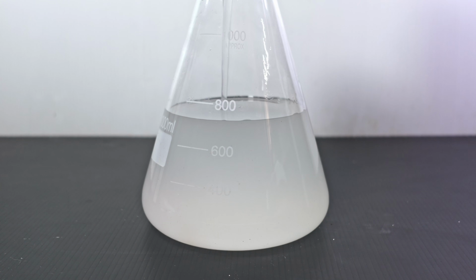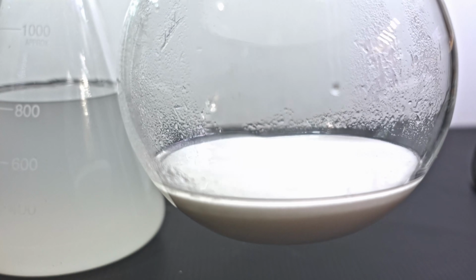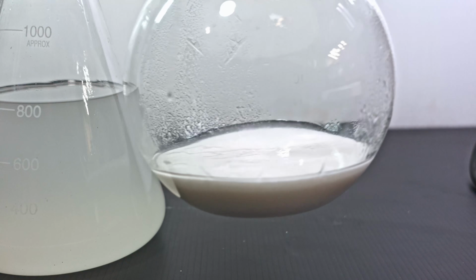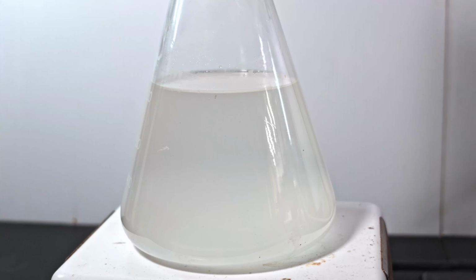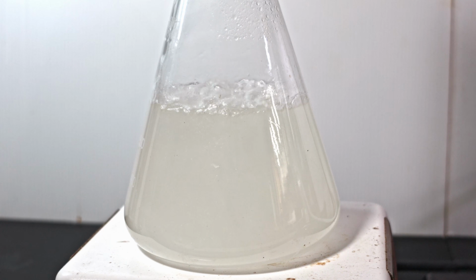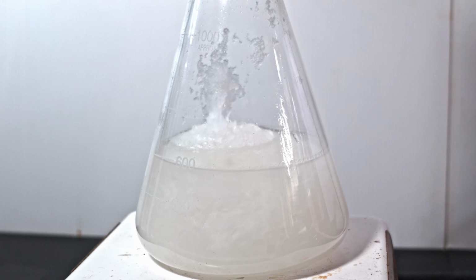I eventually get 800 milliliters of potassium ethanolate. The carbonate cake left is really thick, evidence of decahydrate formation. The small bit of ethanolate left is not worth decanting though. I vacuum distill the potassium ethanolate for a while. It slowly thickens from a runny solution to a syrup to something thicker. It gets harder to boil, and the boiling gets more dramatic.